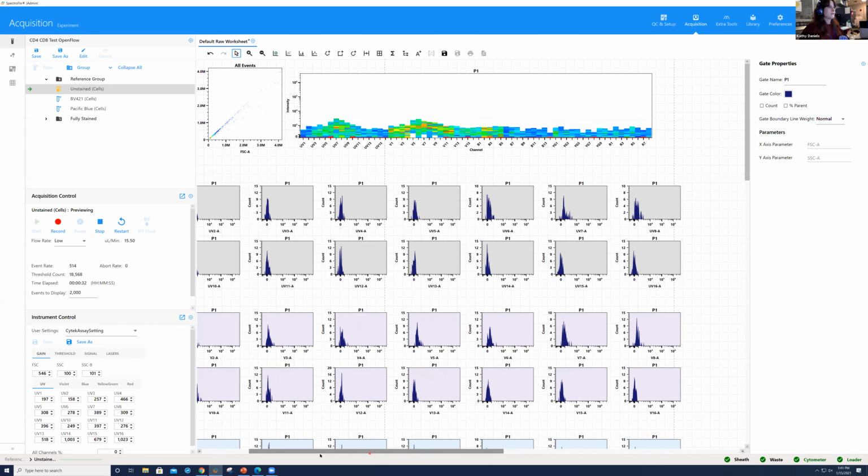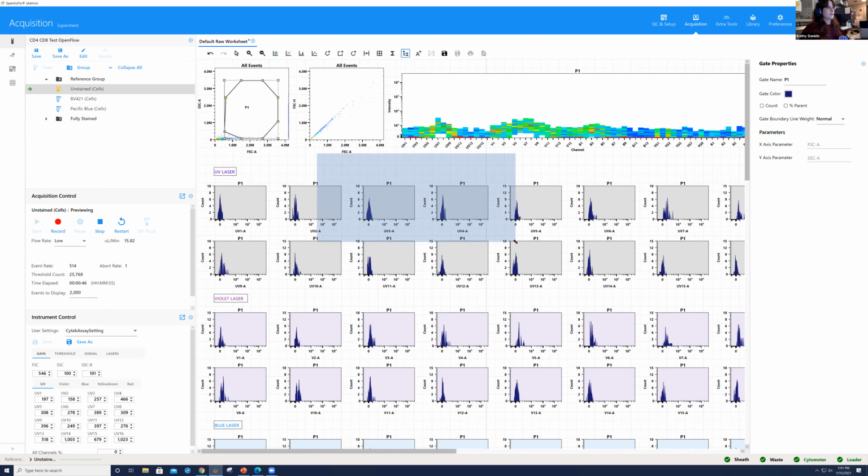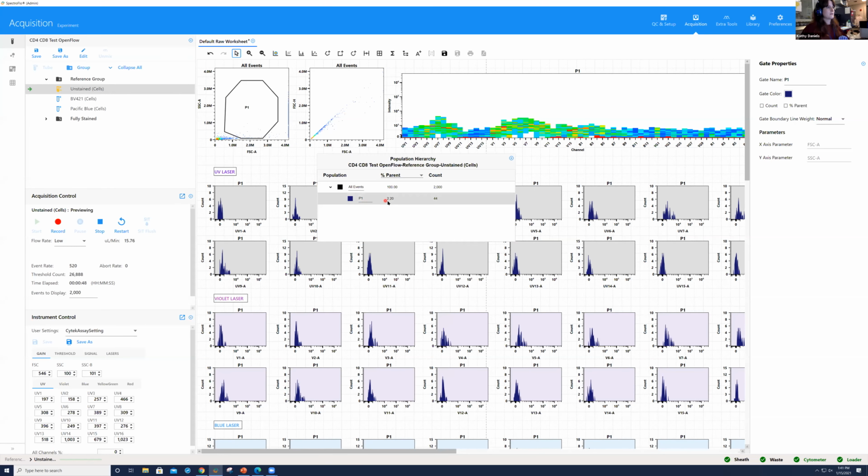So I'm going to make this P1 gate a bit bigger. And I'm going to try and show our population hierarchy here. If I click on the population hierarchy and I click and drag, this P1 has 2%.